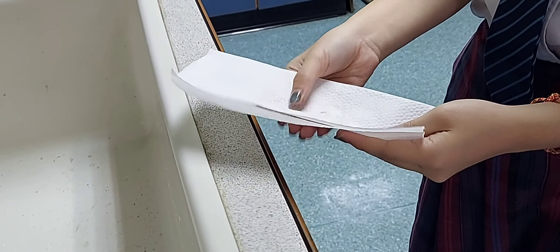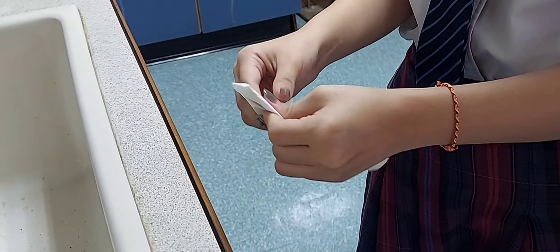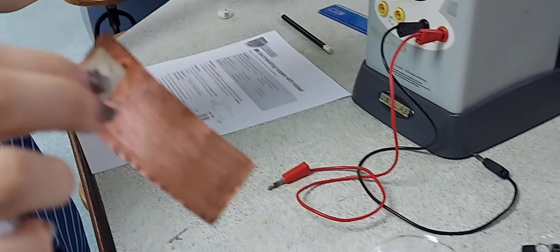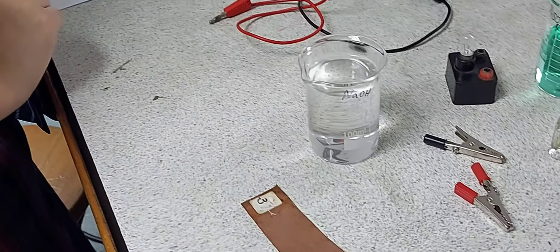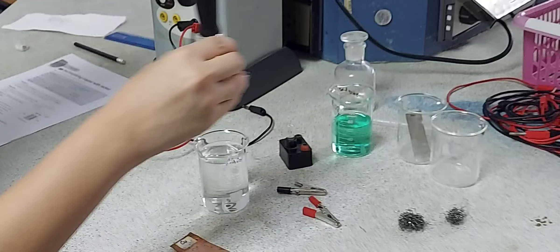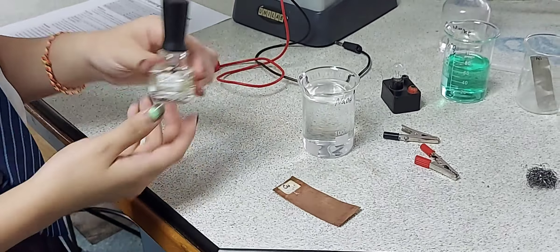This is the copper plate on which we are going to plate nickel. This copper sheet will be used as the cathode — it is connected to the negative electrode. Before doing that, you can write your name or draw any small symbols or flowers on the electrode, because you are going to electroplate it with another metal. Using nail varnish, you can draw something onto the electrode.